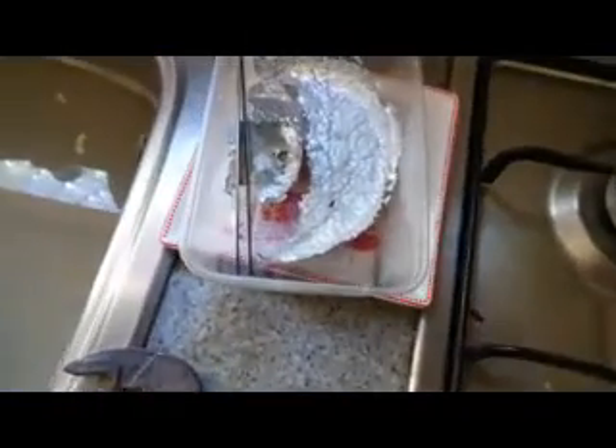Some of it powdered up nicely and some of it just didn't want to powder up, so you end up with some pure metal which is fine to put in solution, and some powder. I also ended up with some slag which is all the impurities, and I just put that in my stock pot - so I made use of the whole lot.